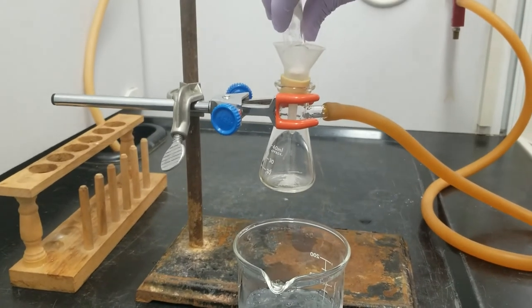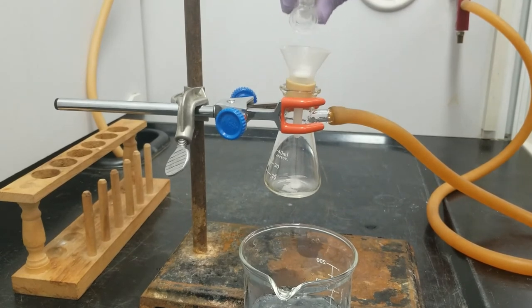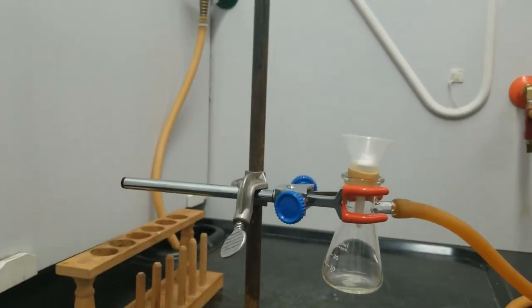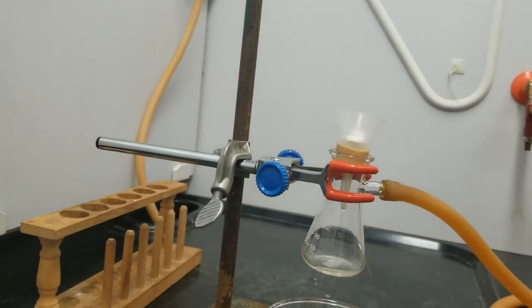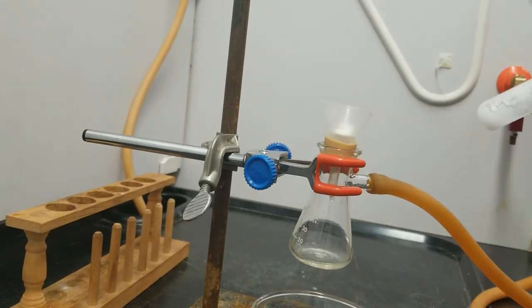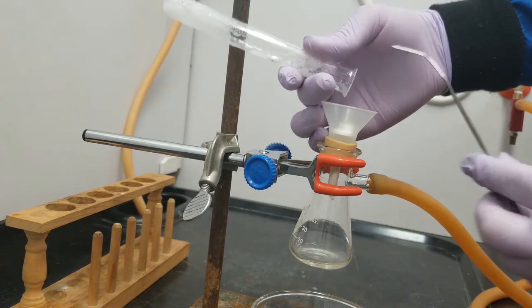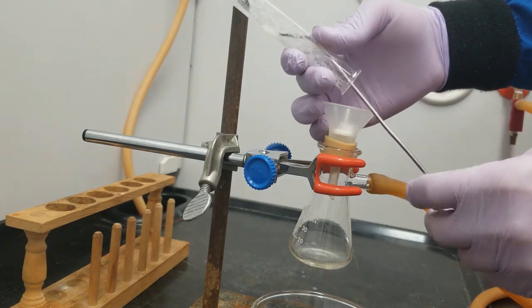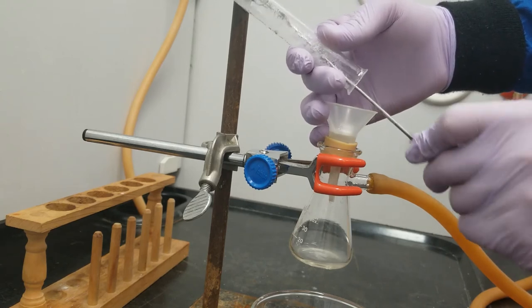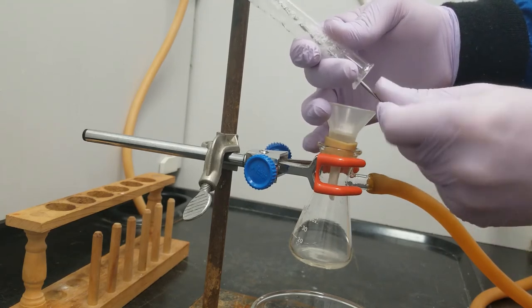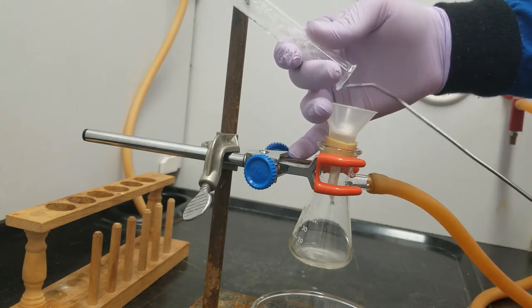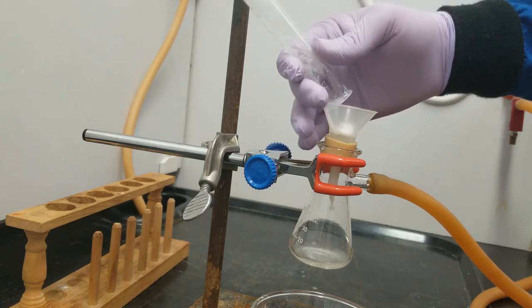And it is not pouring super well for me. I'm going to need to scrape it out with a spatula. Okay. So I've gotten most of it out.